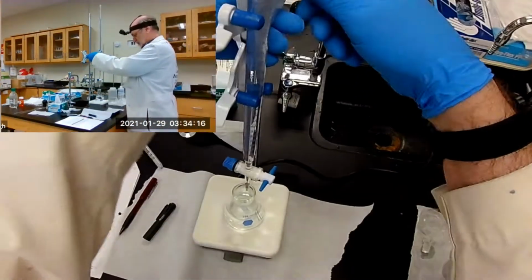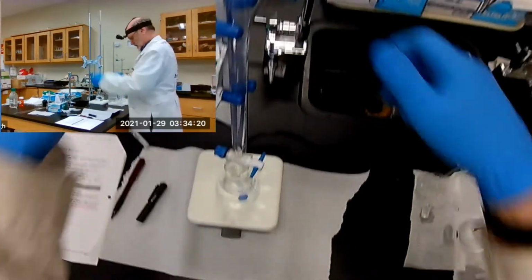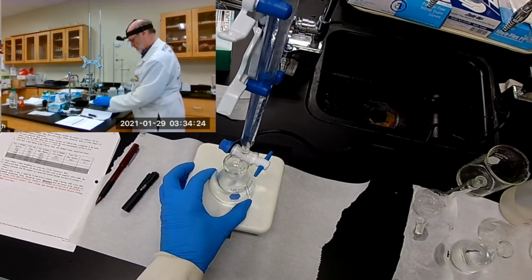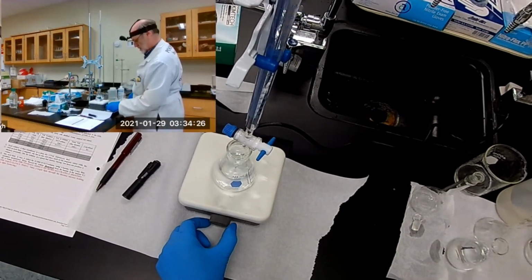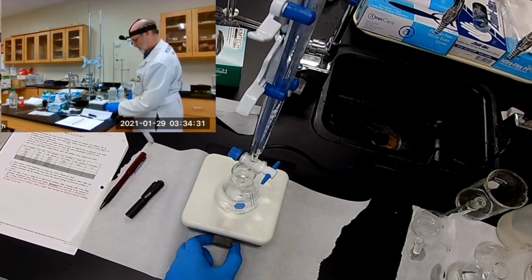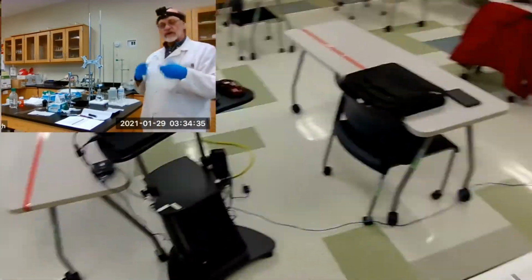All right, let's drop this down and start to stir. Oops, too much. Back it off a little. There we go. Now I'm going to cut the lights again.